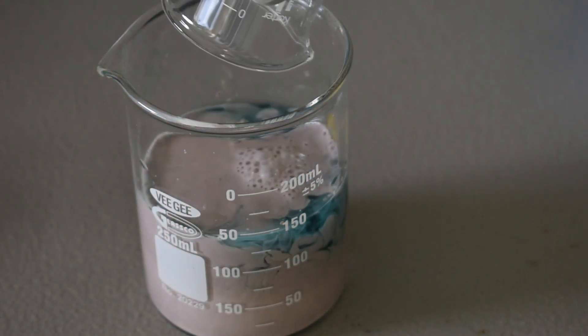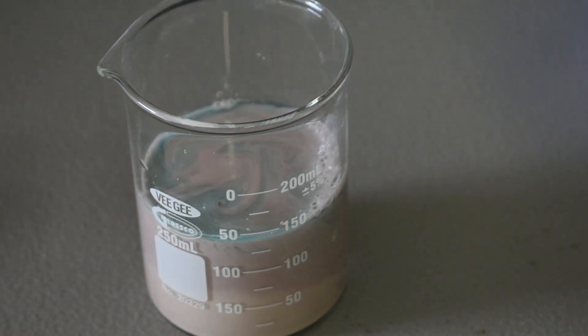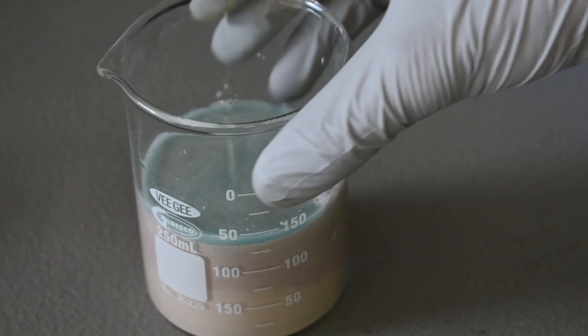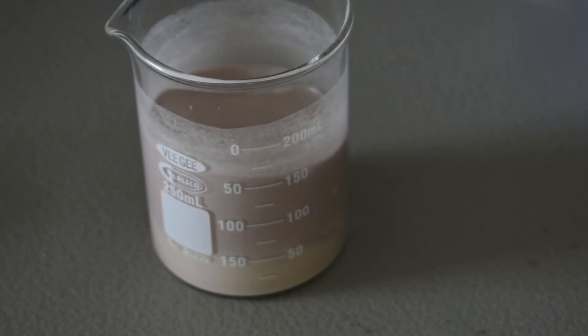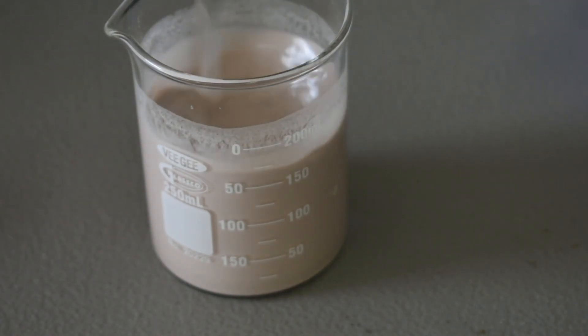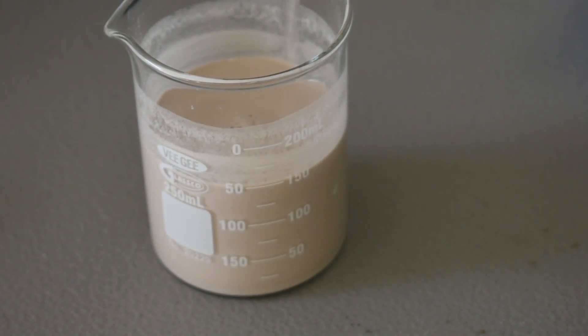Let's add this. Oh yeah. So it's a little pink because the sulfuric acid I used has a little bit of dye. It's drain cleaner acid, but it shouldn't affect anything. Here we go. It's a murky brown pinkish suspension. And I'm going to stir that with a stir rod. And I'm going to let that settle out. And then we can do a quick gravity filtration, and then we can move on to actually making our fluorescent copper complex, which will be very exciting.